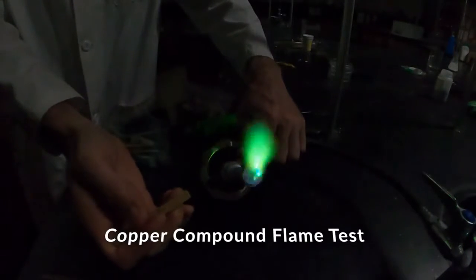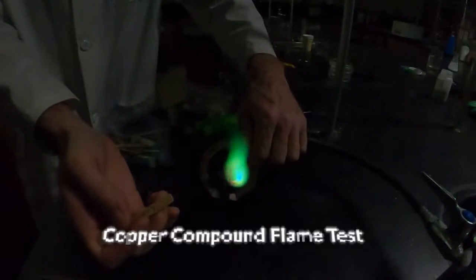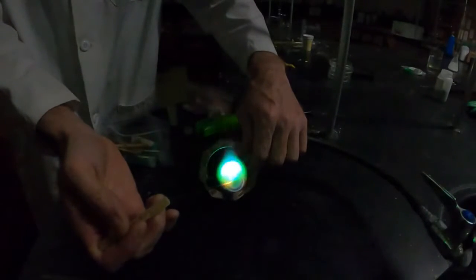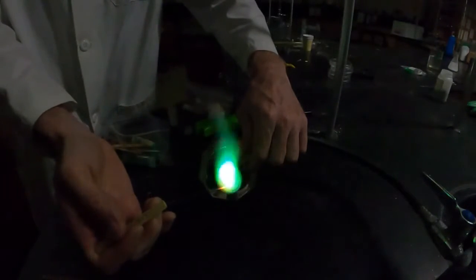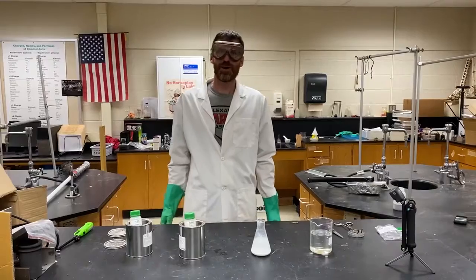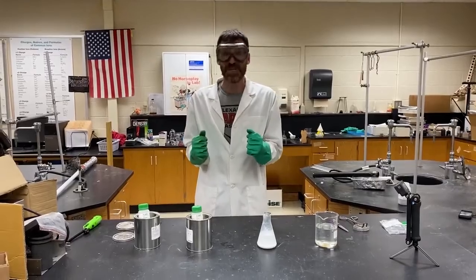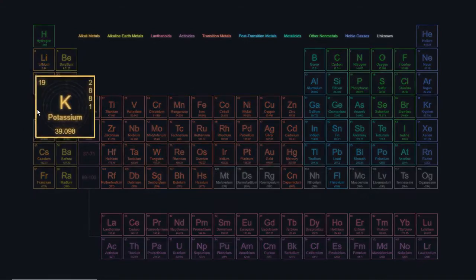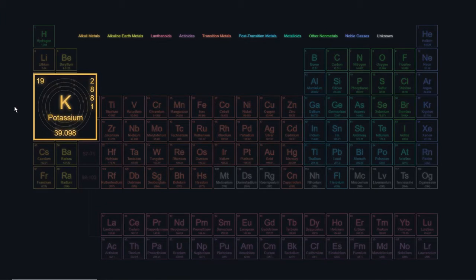So that one was orange. You're like, well, that didn't look any different than my normal fire. Well, you'll see in the next one, the potassium, a slightly different color. That's one of my favorites as well. All right, the last one. The excitement is building, and we've got potassium next. The next up on our list, and the last one that we have access to.